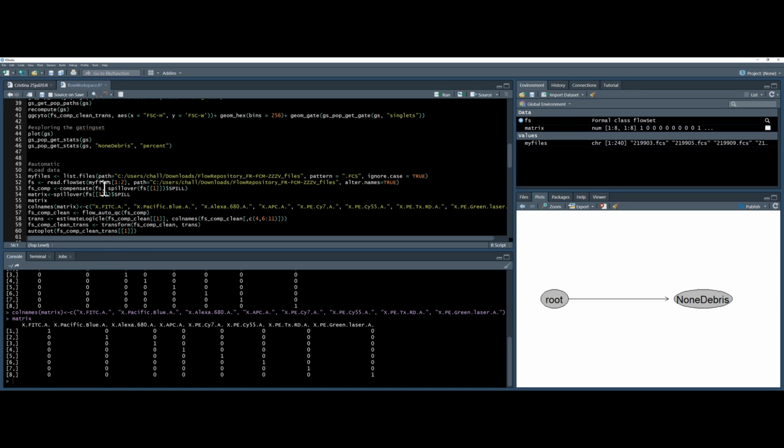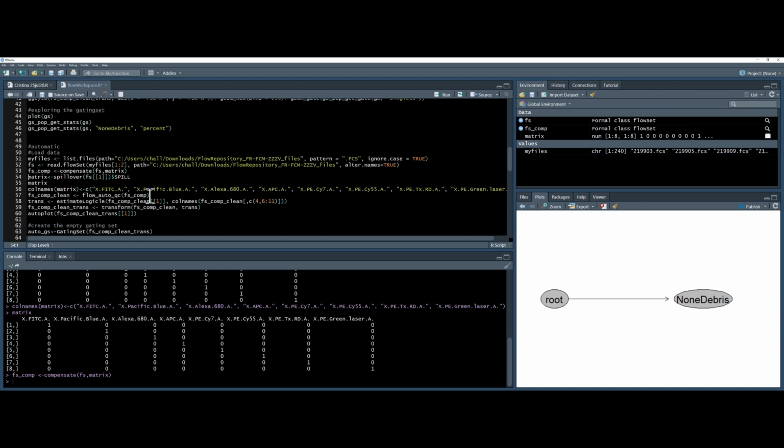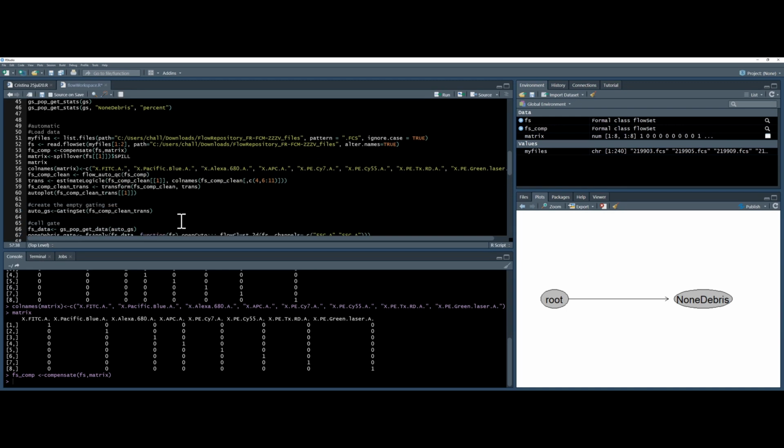So I can change my compensate command to compensate, flow set, and matrix. And that should work. As you can see, as usual, the matrix is empty, so there was no point in doing this. But it's a nice thing to show you through the troubleshooting steps, especially if you're analyzing other people's data like I'm doing here. So again, we're going to use flow AI and then transform the data.